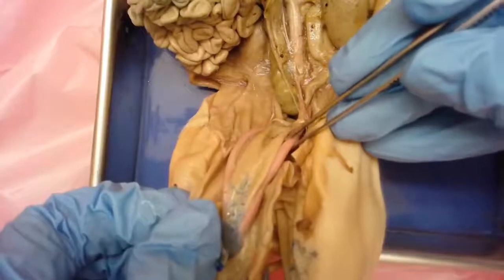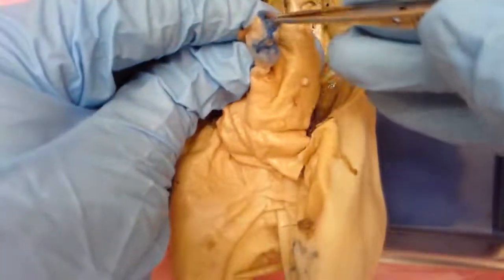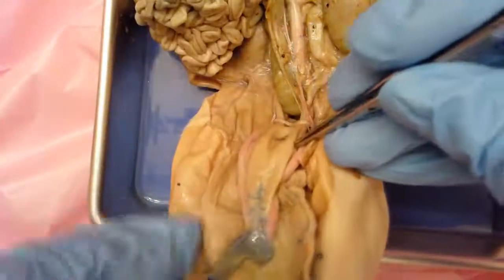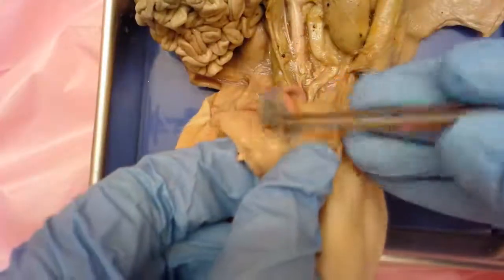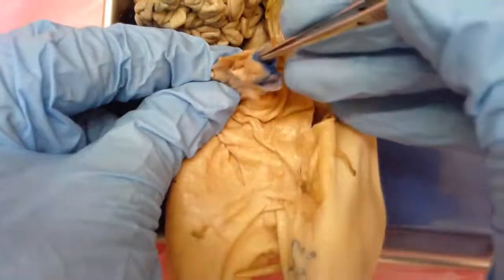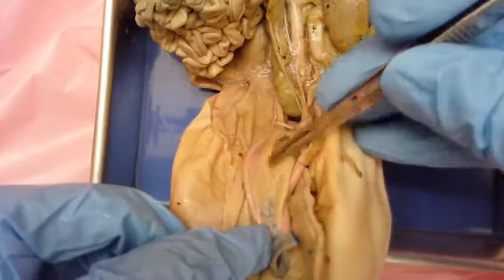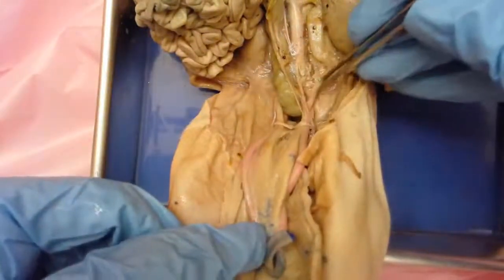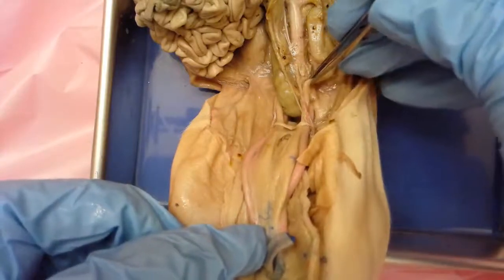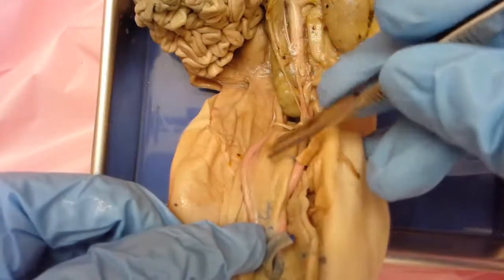The urinary bladder is this long tube that's actually in between the two umbilical arteries. We talked about the umbilical arteries in our first dissection video — those were the blood vessels in the umbilical cord. There were two umbilical arteries and one umbilical vein. The urinary bladder is in between there, and you can see where the ureters attach to it. Urine flows from the ureters out of the kidneys and enters the urinary bladder, where it gets stored.